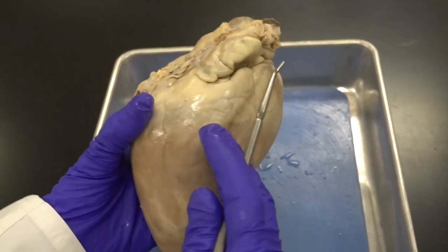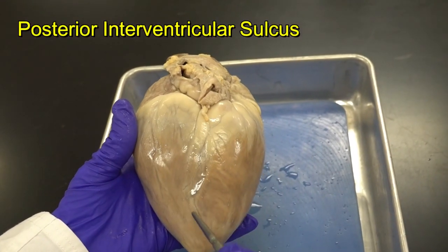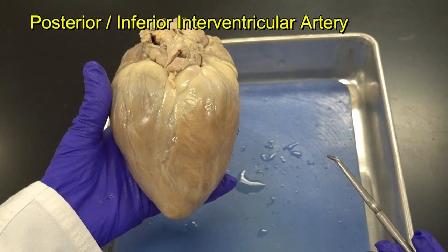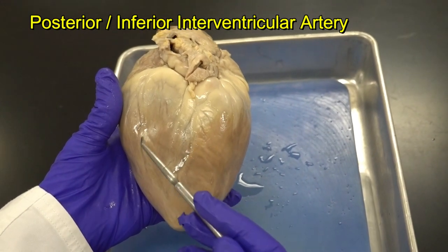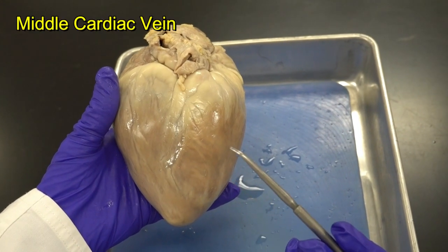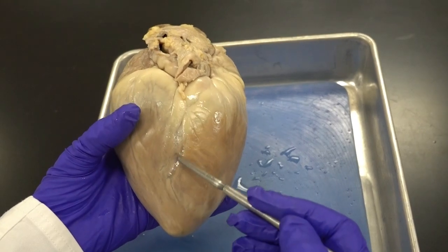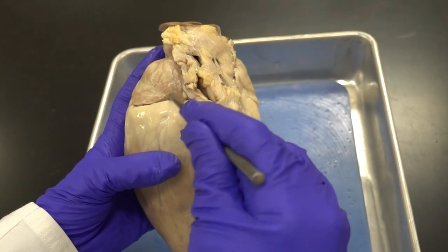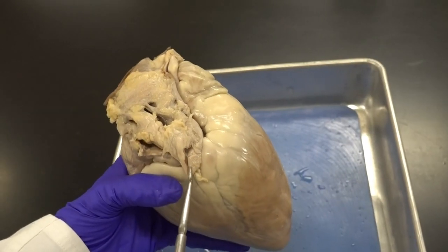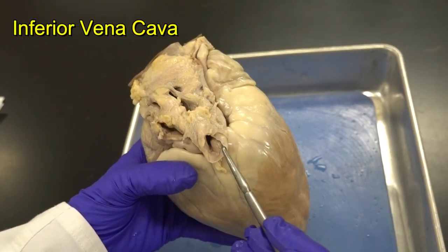Now looking at the posterior side — we have three sulci: the coronary sulcus, the anterior interventricular sulcus, and here the posterior interventricular sulcus. In the posterior interventricular sulcus we find the posterior (inferior) interventricular artery, which supplies the ventricles posteriorly with oxygenated blood, and the middle cardiac vein, which collects deoxygenated blood from the posterior ventricular wall and sends it into the coronary sinus deep in the coronary sulcus.